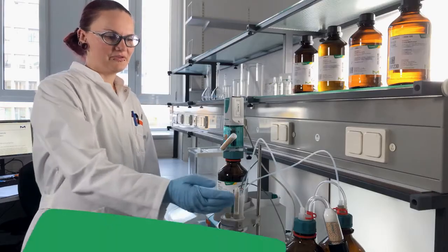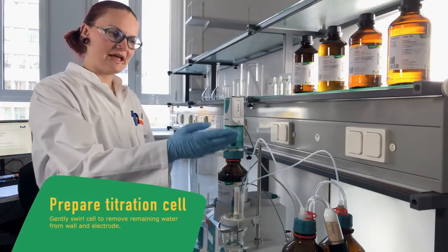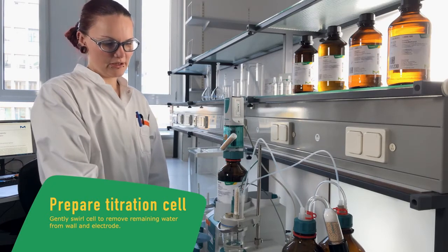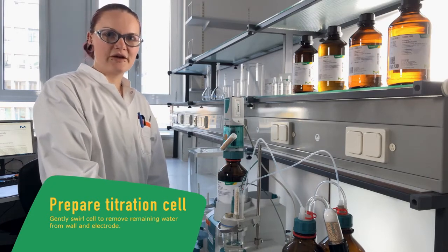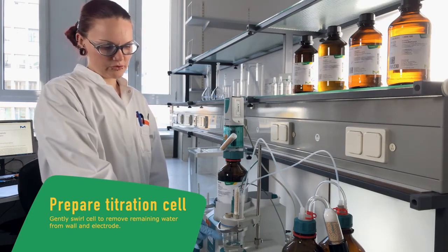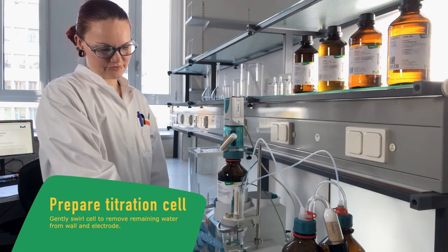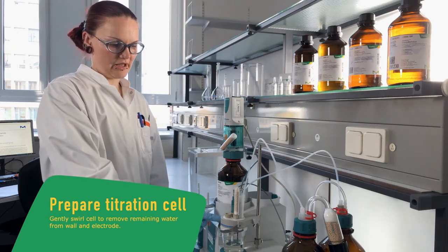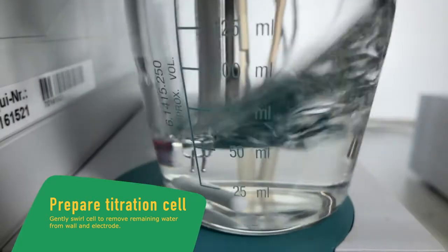When fresh solvent is added into our titration cell, we gently have to swing it to bring down the drops of water which are on the side of the wall and the electrode.